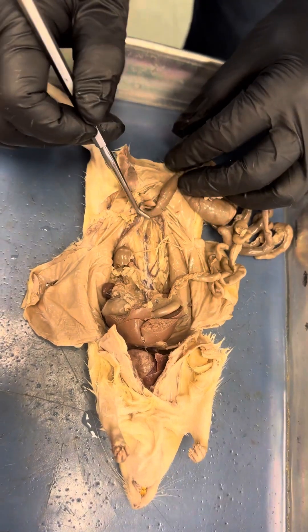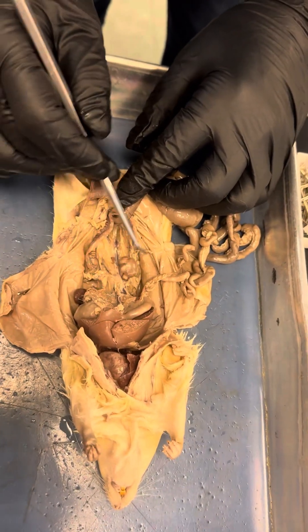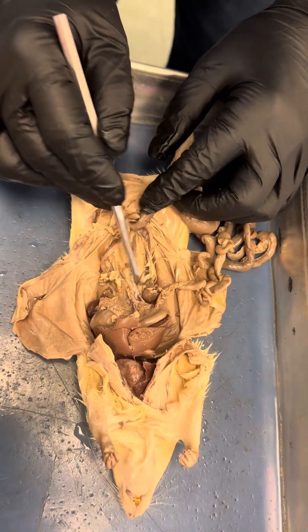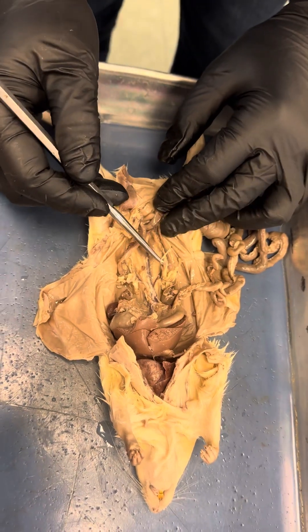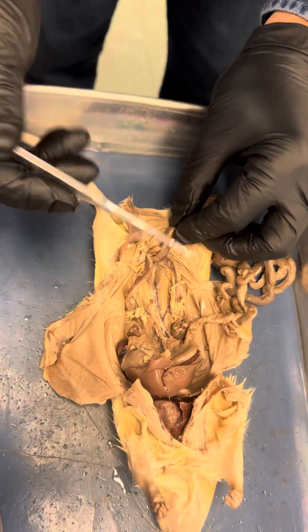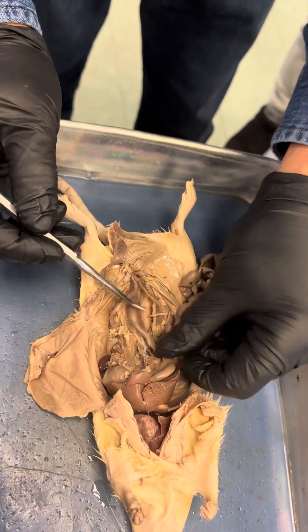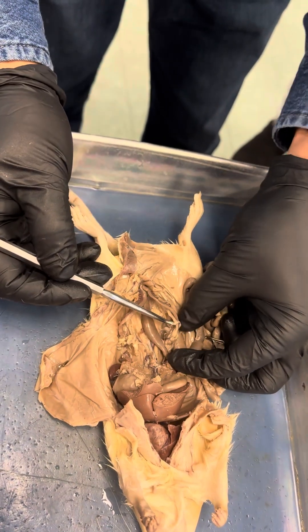In the female, I want to show you one structure right here. This one is the kidney right here. They already removed one kidney before. This is the left kidney. And this structure right here — this is called the uterine horn.